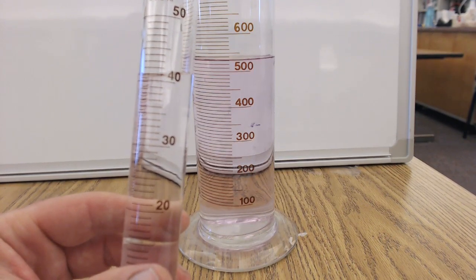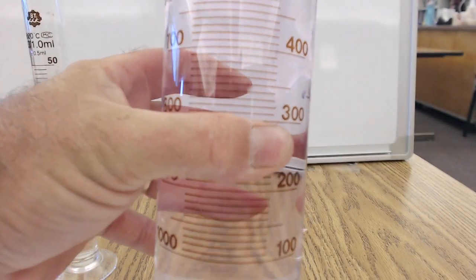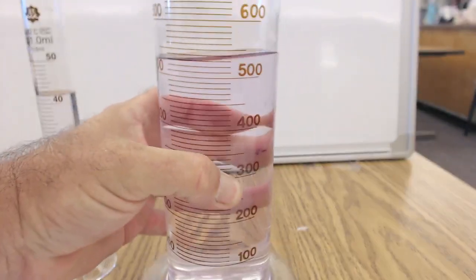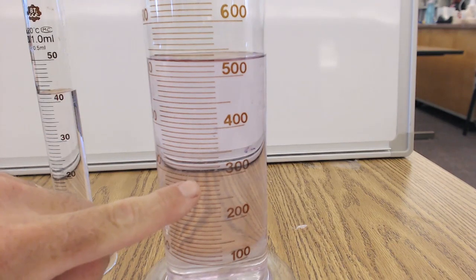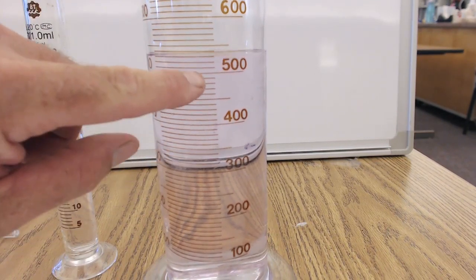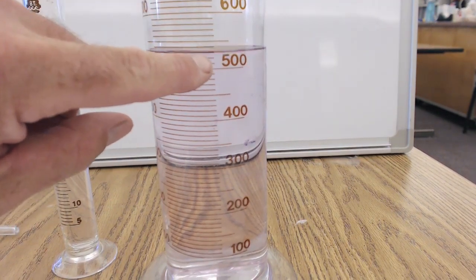the ones place. On the other graduated cylinder, it looks like I know, well, that's kind of zoomed in. Looks like I know, let's see, 300 is right there. And that's 400 and 500. And I know the spaces in between. So let's see, if that's 500 and that's 600, each little space must be worth 10.